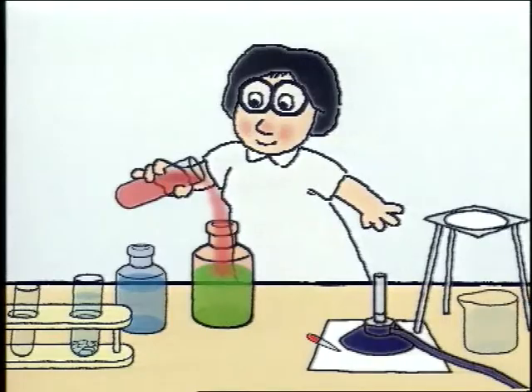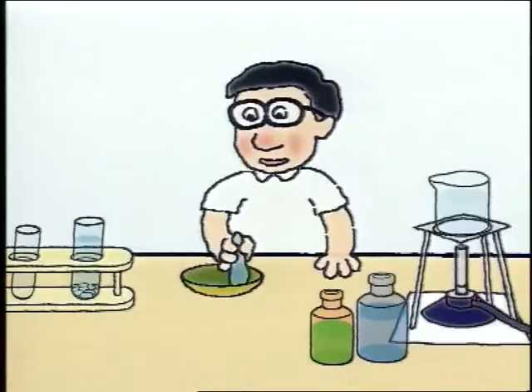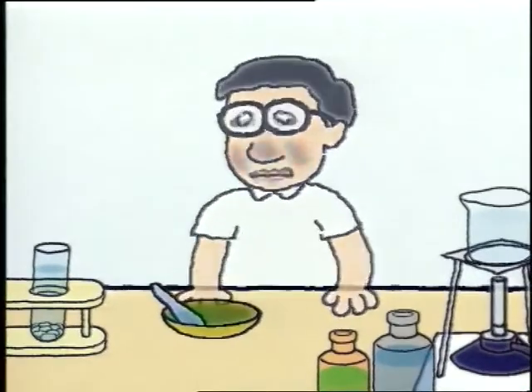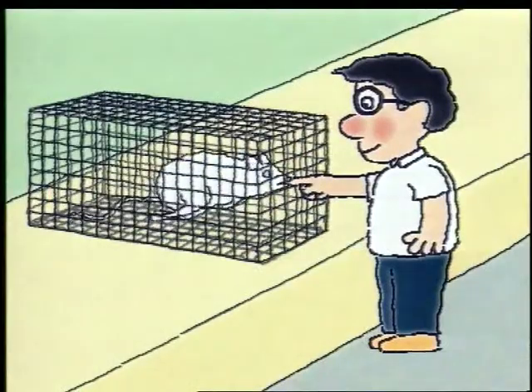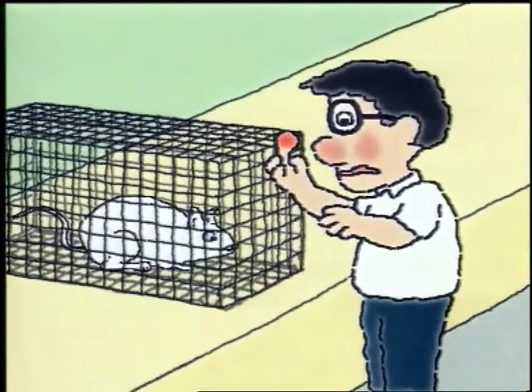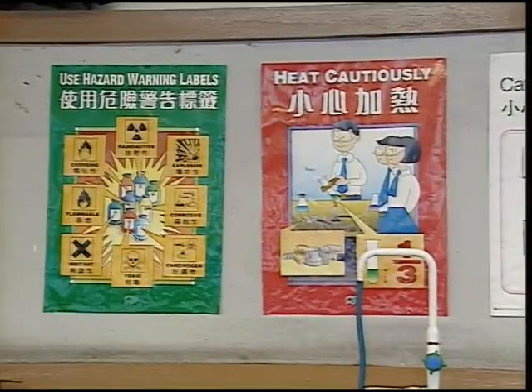The student feels sick after breathing in toxic gases. The student is poisoned by contact with some poisonous chemicals. The student is bitten by white mice kept in cages. To prevent such accidents from happening, you must make sure that the following safety precautions have been taken.